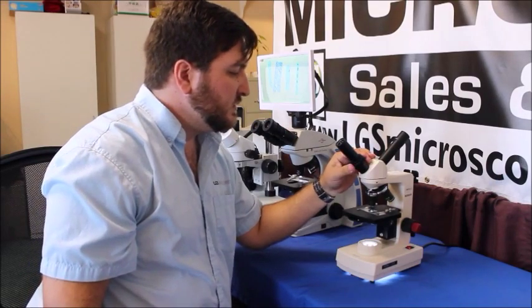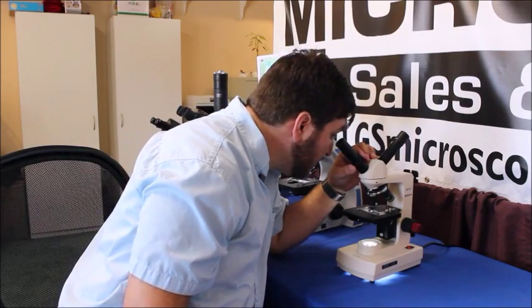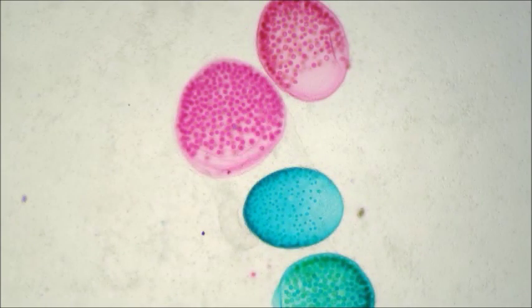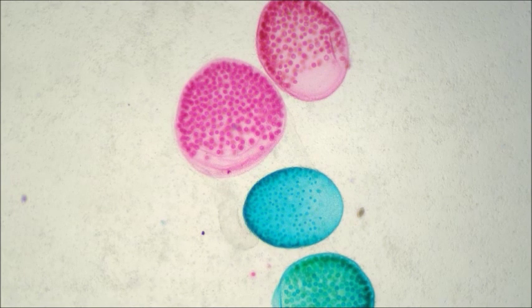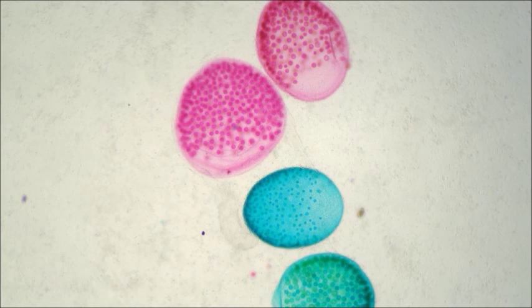So what we're going to do is now that it's in focus on this eyepiece, we're going to look through here and just adjust this until it's in focus for both of you. That looks pretty good.